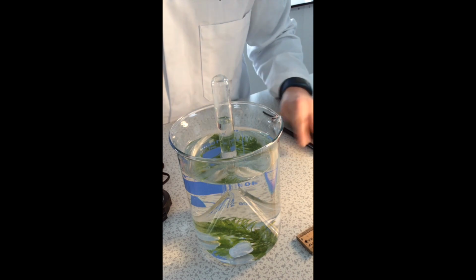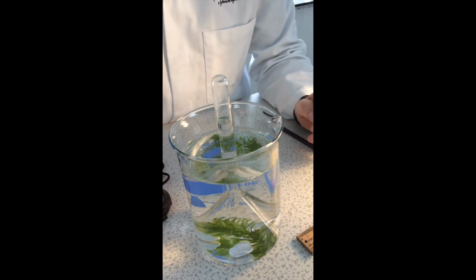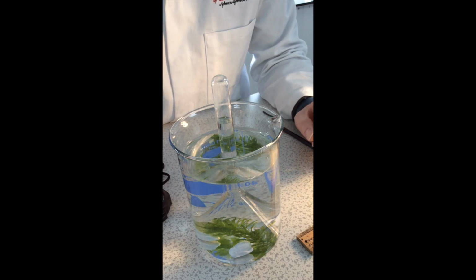Okay, so that's that. I've completed my first trial. I will now recommend that you do it a further 2 times, so you have 3 repeats, and you then can calculate a mean, and this will enable you to judge the repeatability of your results and spot any anomalous results and so on.